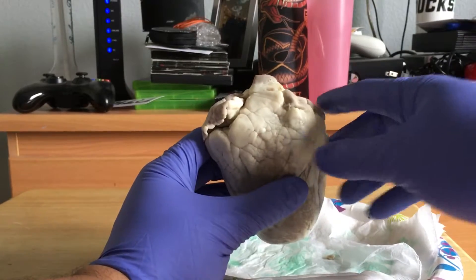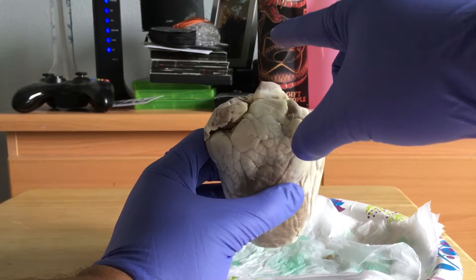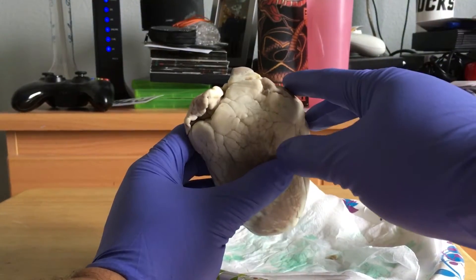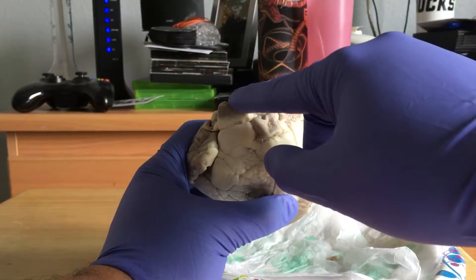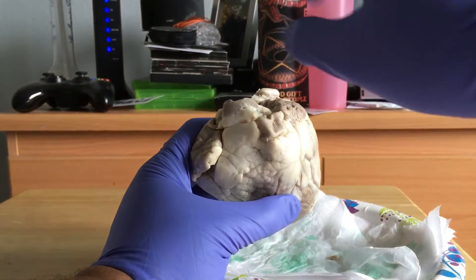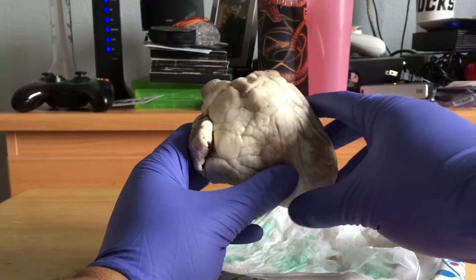The aorta would be over here, and basically the aorta carries oxygenated blood going out to the body. The ascending aorta would be right here, right below the aortic arch. The aortic arch has basically three vessels attaching off from it: the brachiocephalic artery, the left common carotid, and the left subclavian.